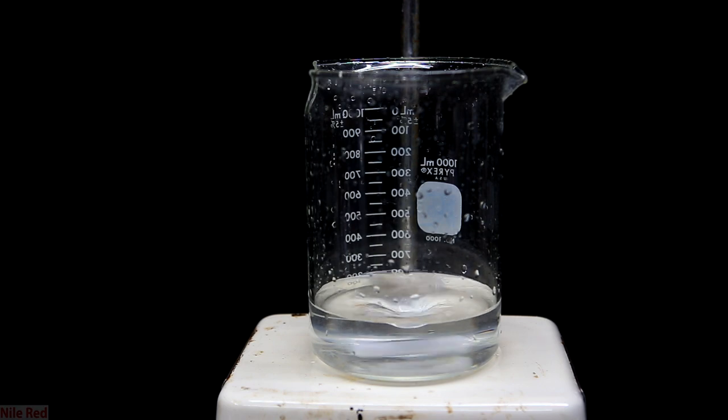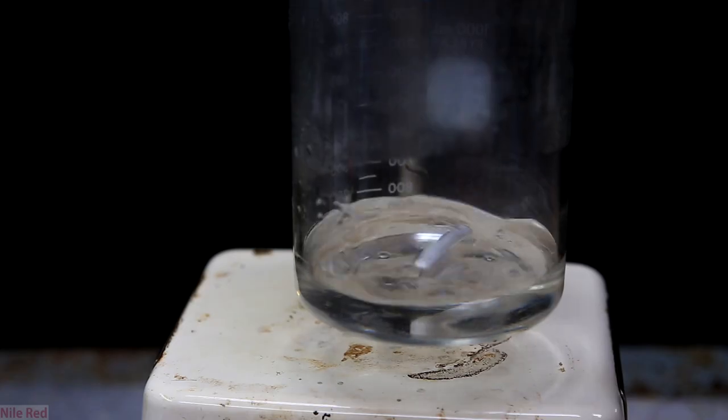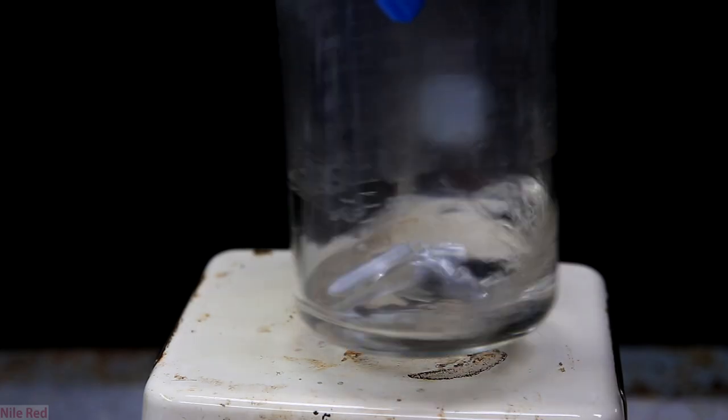I crank up the heat, but I don't bring it to a full boil because I don't want it to be too violent. I don't remember how long it took, but it didn't take that long. It got to a point where the solution started to look pretty thick.